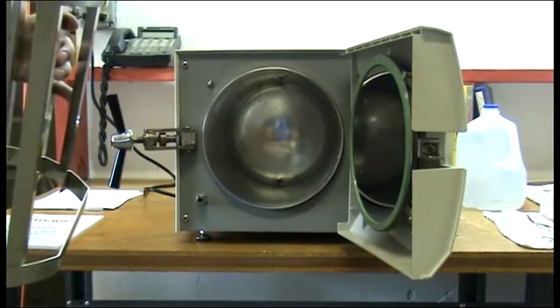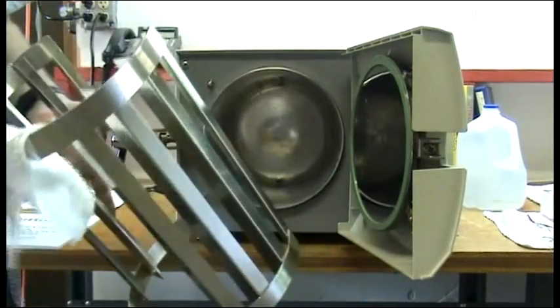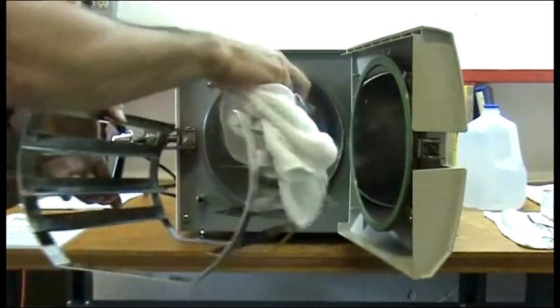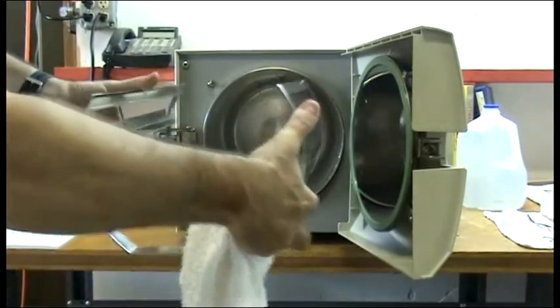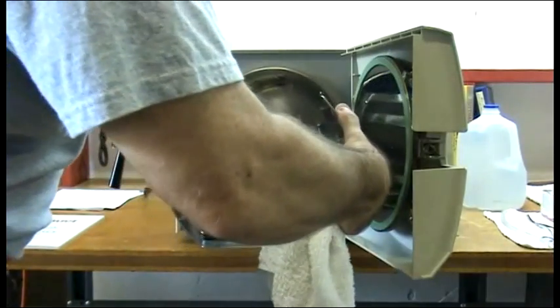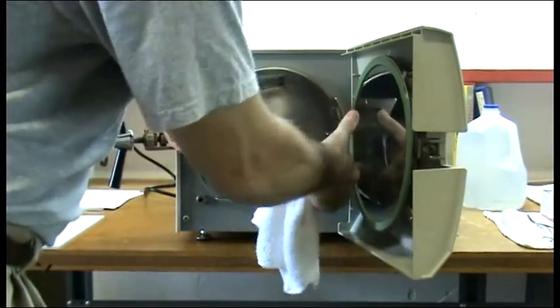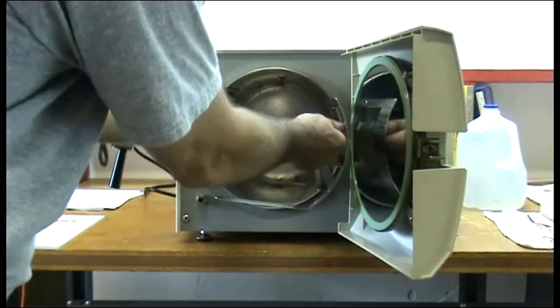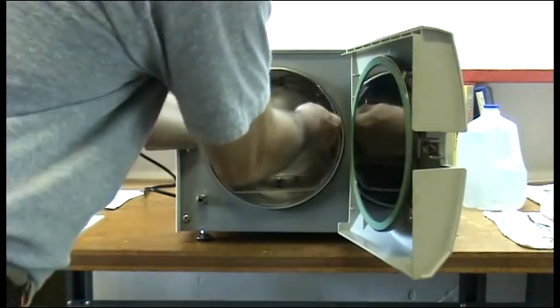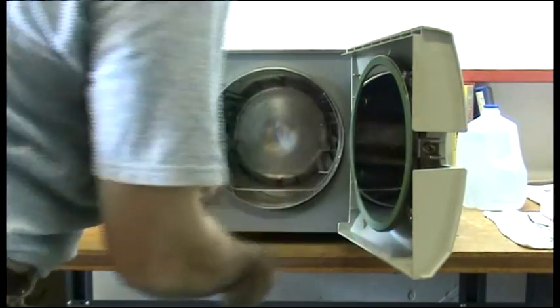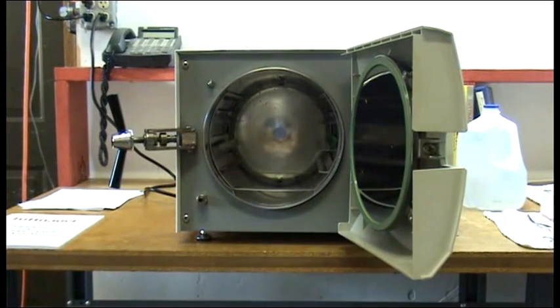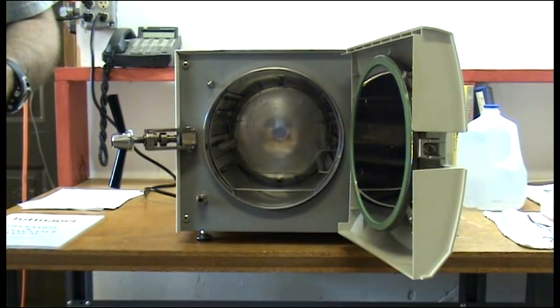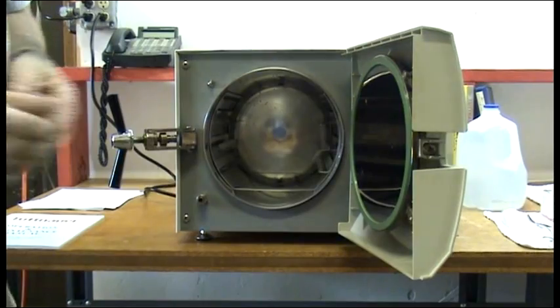Now that the chamber's clean, we can wipe down our tray rack and reinsert it. Press the sides in, reach in and grab the tube, pull together to align the tray. Reinstall the rest of your trays and your cleaning procedure is complete.